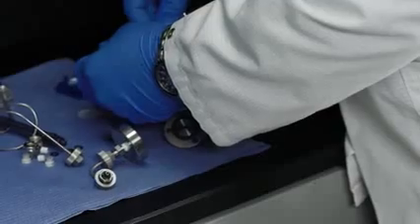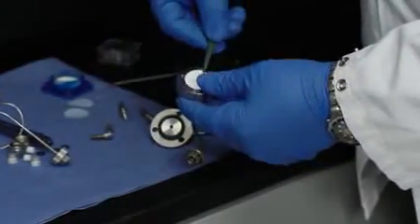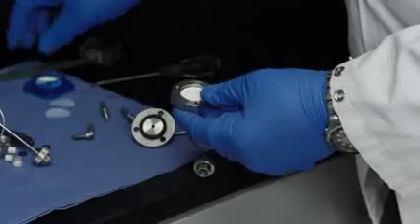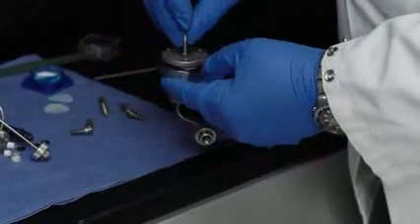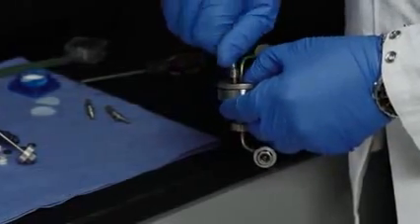We now have swivel screws that replace the hex screws, so you don't need any special tools to assemble the JFTOT 4.